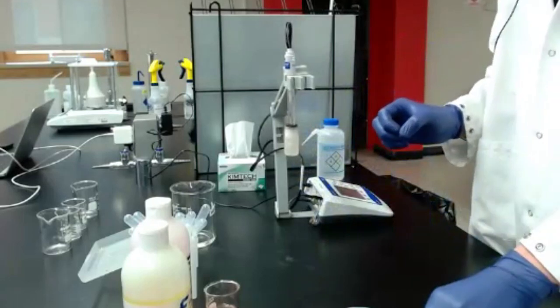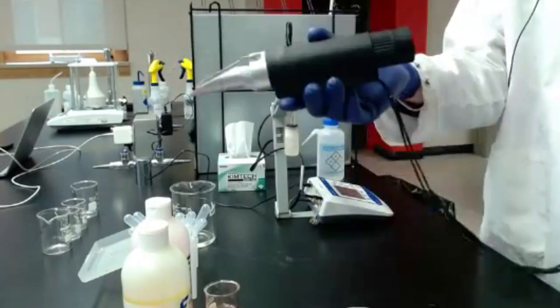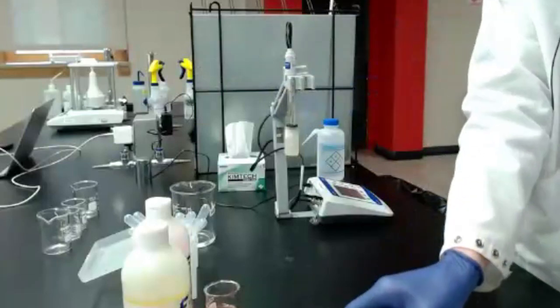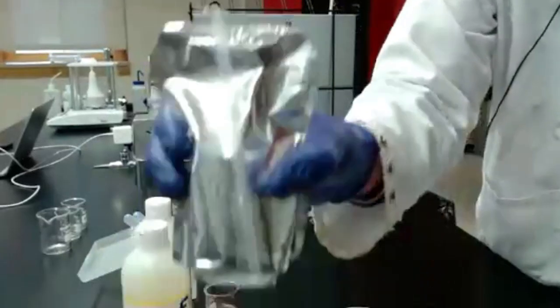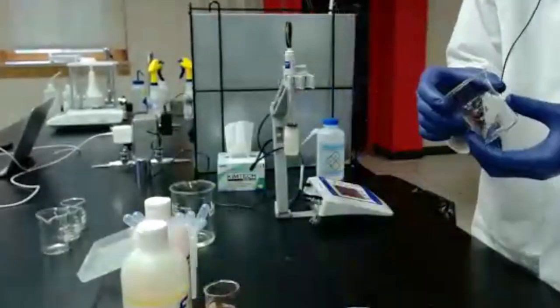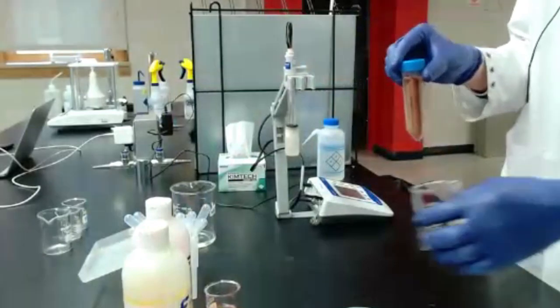All right, I'm going to start by demonstrating how to measure total soluble solids, or Brix. And I'm going to start with the manual refractometer. So if you have one of those, go ahead and get your grape juice open. You'll need a small beaker or a tube or something like that. You can either just cut the top off or dump it in a cup. Please don't drink it. I know it comes with a straw, but I've got mine in a little tube here. So just have that handy.